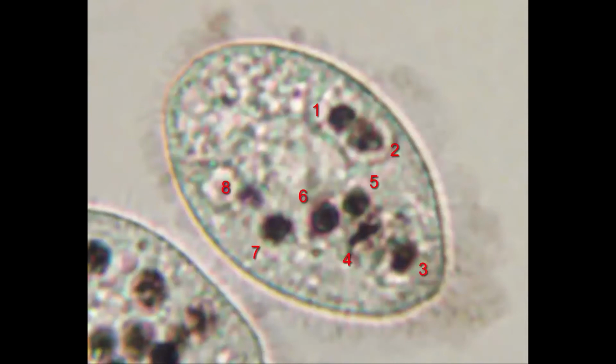Often there are some tricky calls to make. Zoomed in like this, it's easier to tell that this mass is 2 vacuoles right next to each other. This more faint spot is likely a vacuole out of focus, so we'll include that. I think this oddly shaped structure here is a vacuole in the process of forming, which I typically include in my counts. I don't count these tiny black dots that you often see at the wider end of the cell. The most important thing is to be consistent.